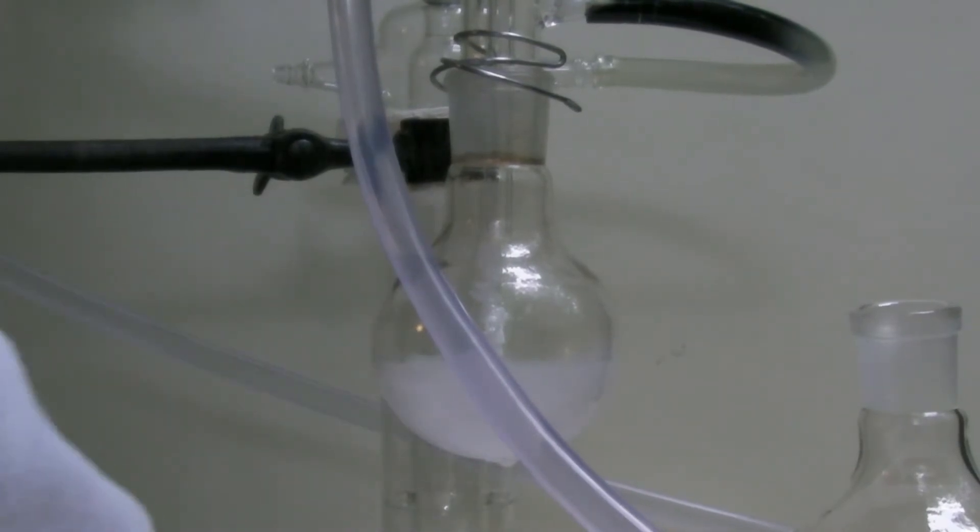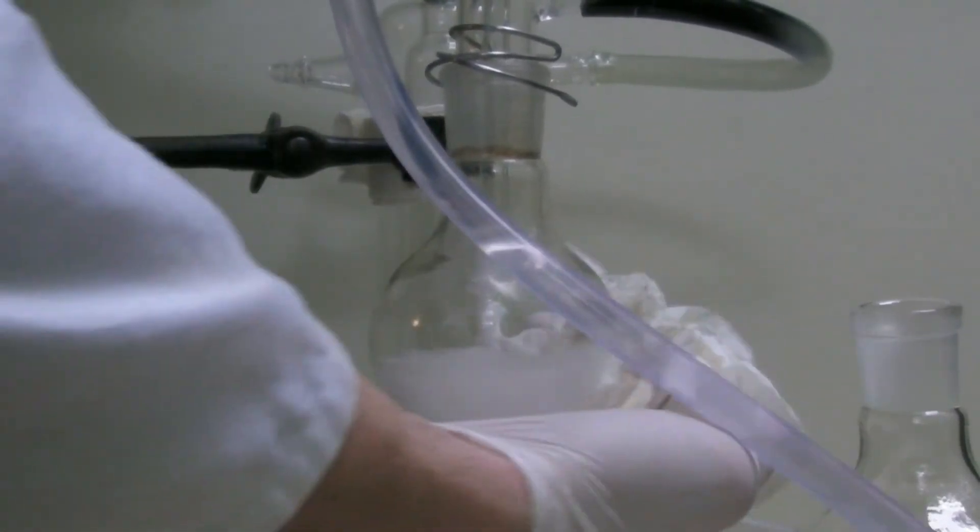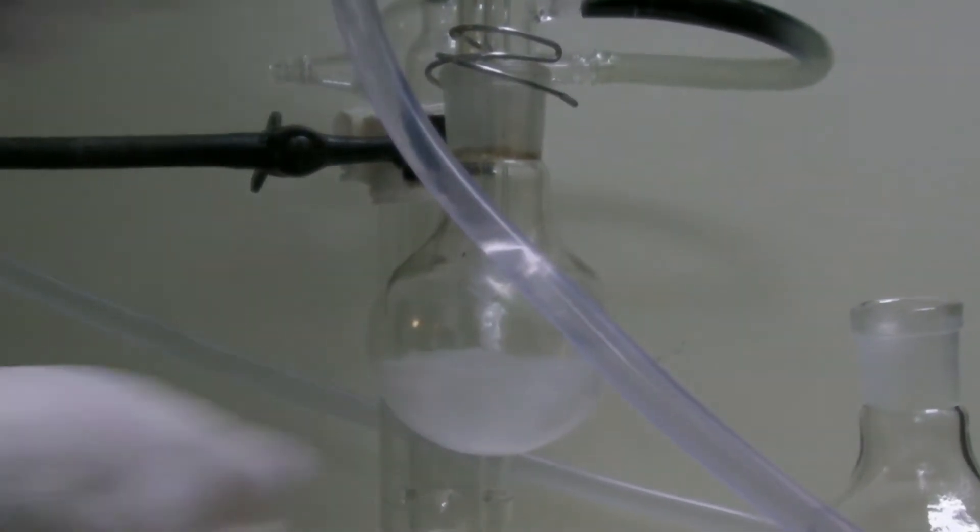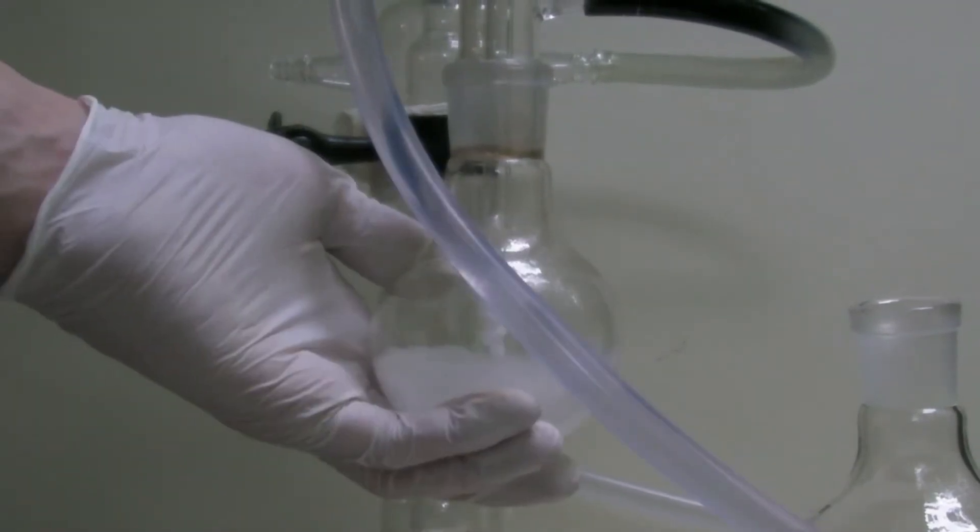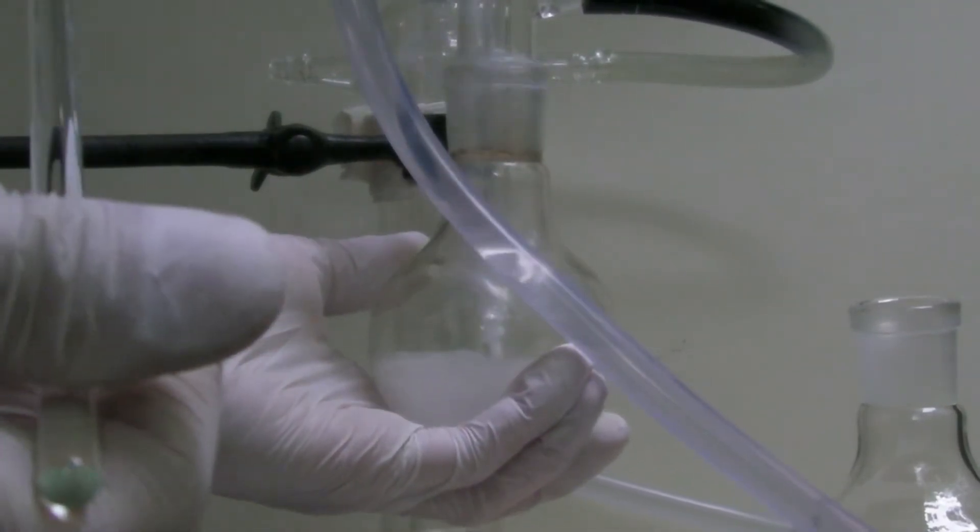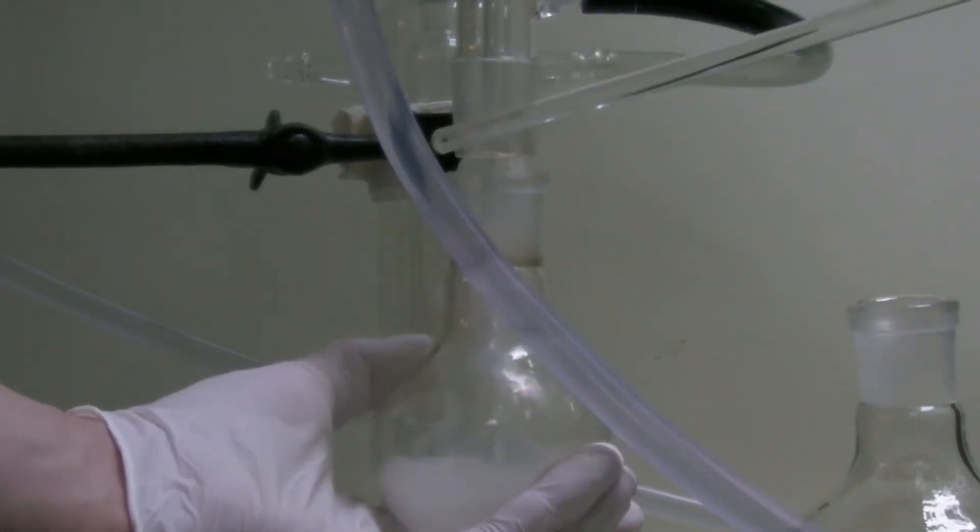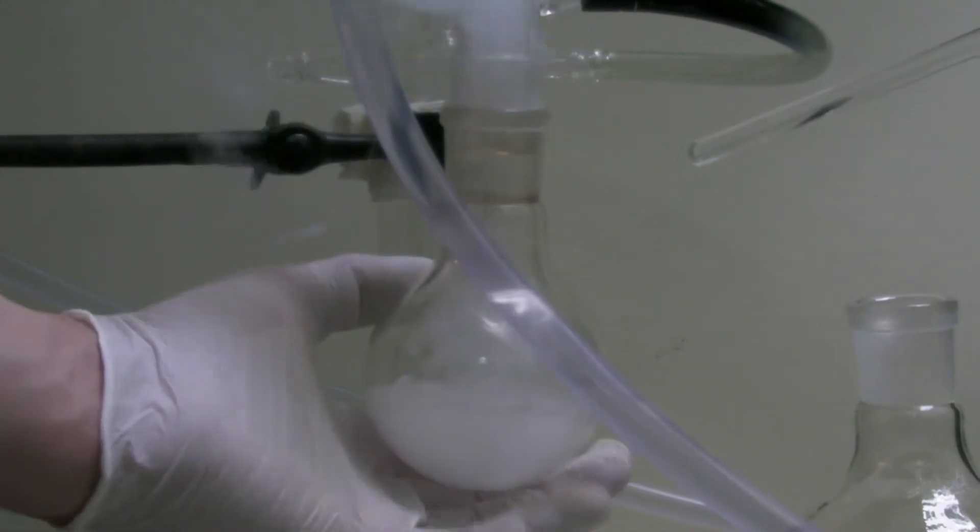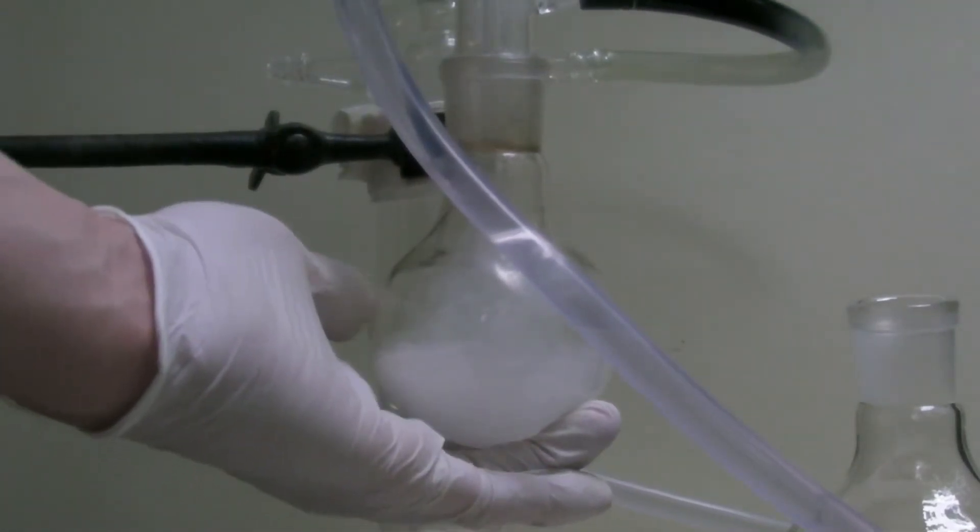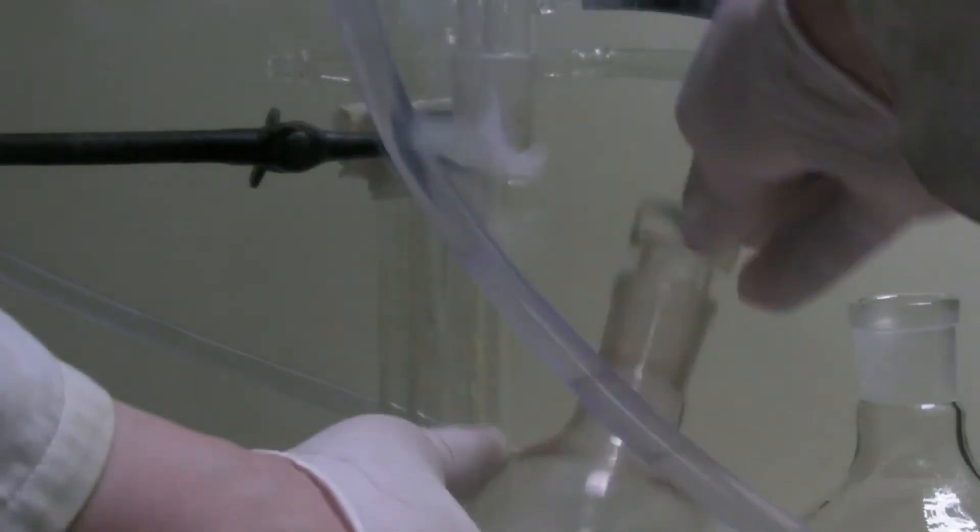To remove the receiving flask all water in the surrounding area was removed as good as possible and an empty flask was held close by. The sulfur trioxide was loosened with a glass rod. Then the flask was closed with a greased glass stopper and the empty flask was connected to the apparatus.